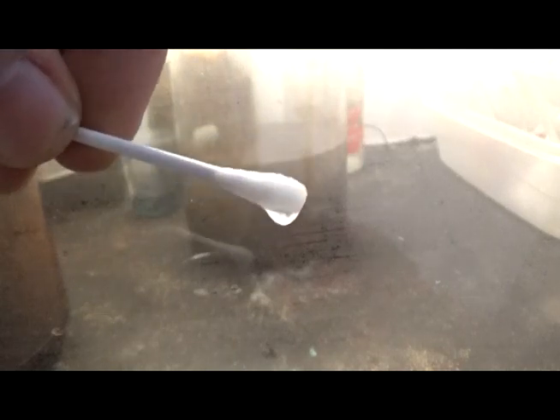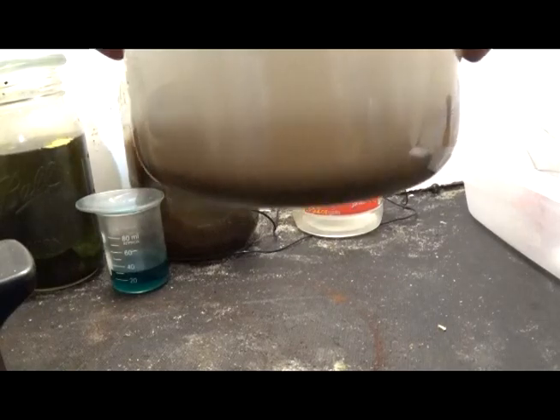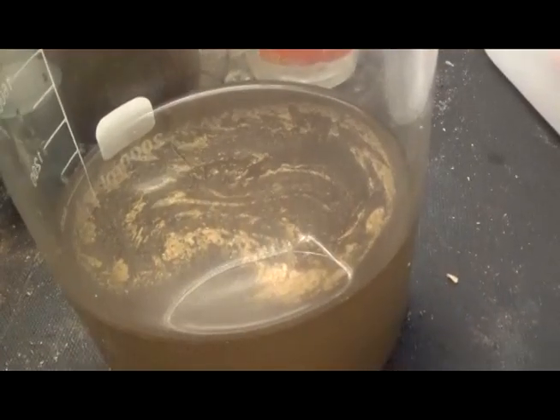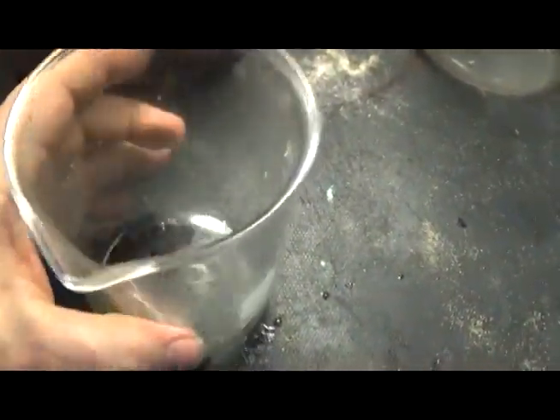So we're going to get a sample of this and see if we've got all the gold dropped down out of solution. It's going to get a little foggy here for a second, so just bear with it. Looks like we may have gotten it all. I'm not seeing any indication. Sometimes it takes a second. We have a successful drop. It may have turned it a little brown, but it's not worth chasing. A little layer of gold down there. Don't know how much. I think I said between 1 and 2 grams at the most. We will see. We got some gold riding the surface tension of the SMB crap sewer water. There's our gold. About what I expected.